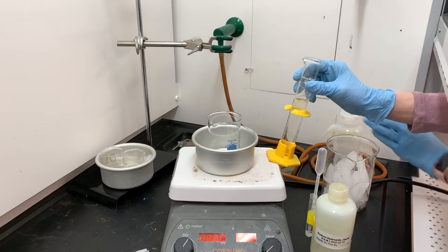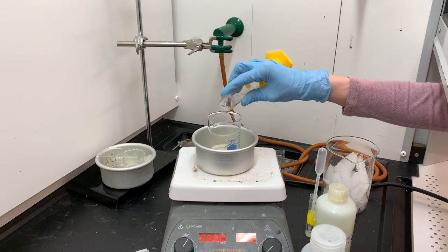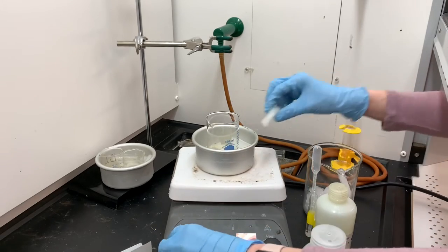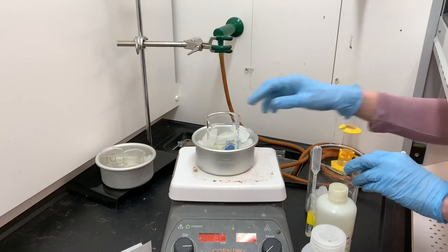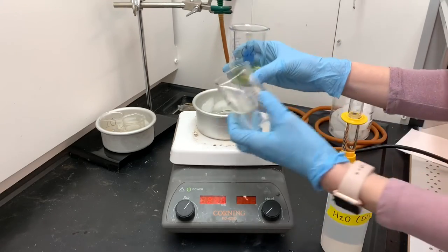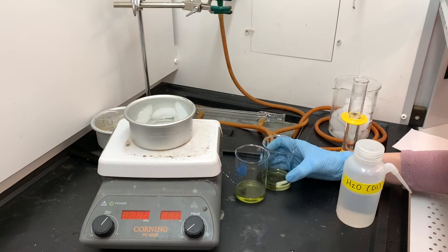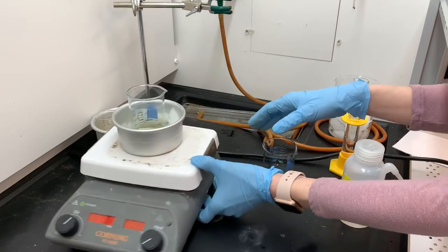The instructions ask for 40 mL of 1 molar sodium hydroxide. I didn't have 1 molar NaOH so I used water to dilute that 6 molar solution. All we have to do is wait for the resorcinol to dissolve in the sodium hydroxide solution, and I'm keeping it on ice during this process. My resorcinol has dissolved in the sodium hydroxide and it's this cool green color. Next I'm going to divide it into two portions in beakers labeled C1 and C2 — the C is for coupling component. This is the same as what I did with the diazo component in beakers D1 and D2. I'm eyeballing the volumes to get them roughly the same. The C1 beaker I'll put back on ice to use later, and I'm going to work on the C2 solution.